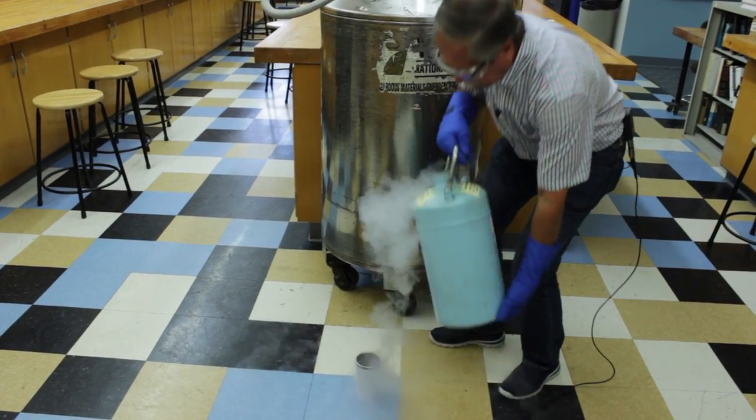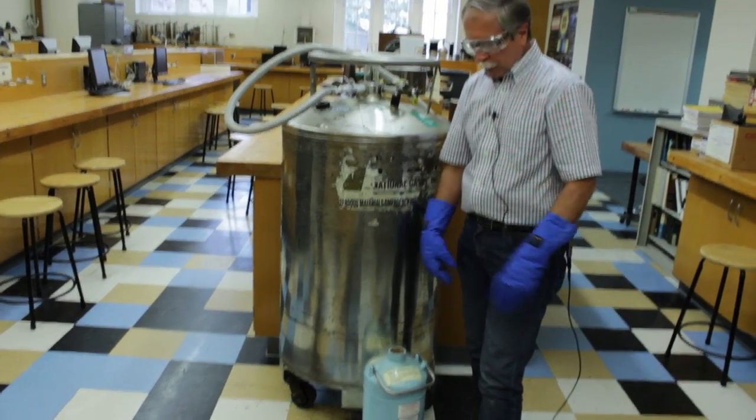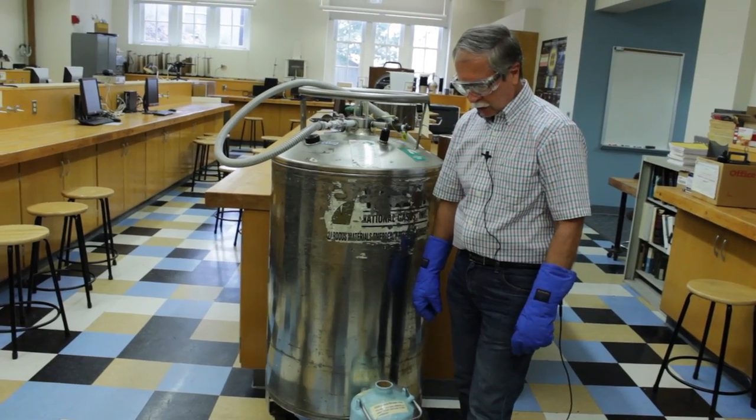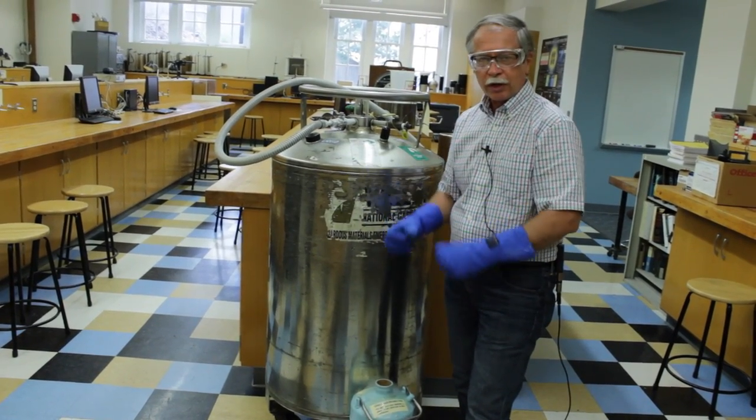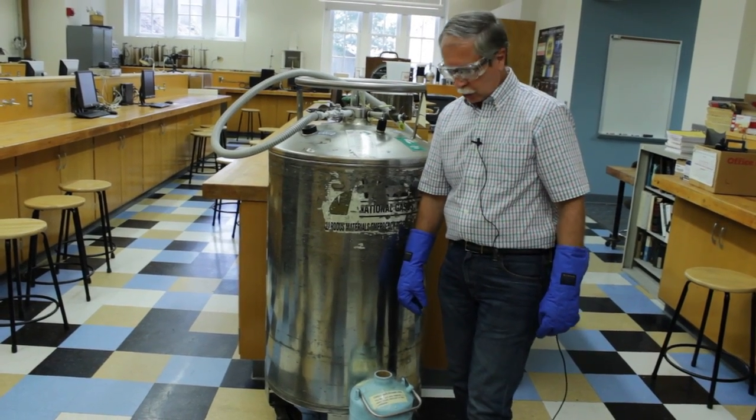And slowly fill it up to the top. But once the liquid stops boiling, then you can pick it up and carry it to your station, put it securely in the little ring stand to minimize the chance of having it spill on you.